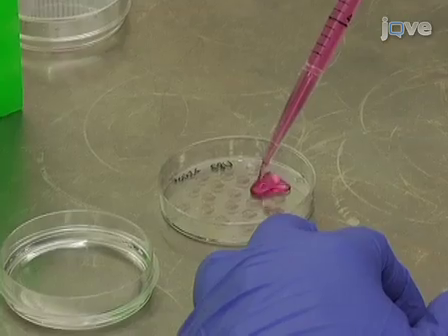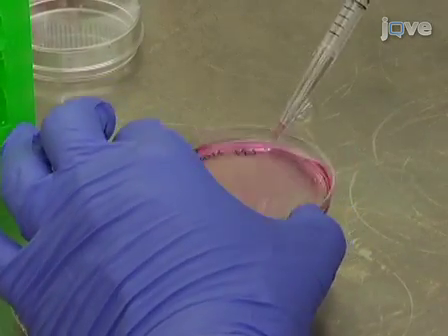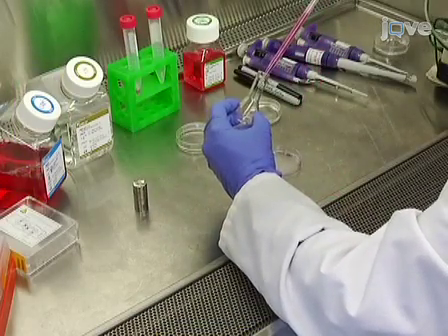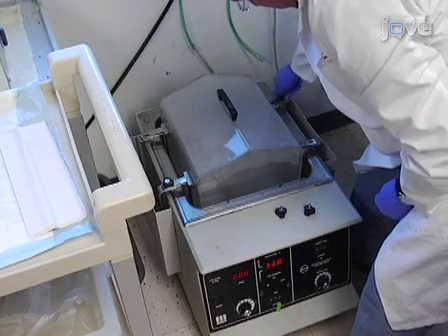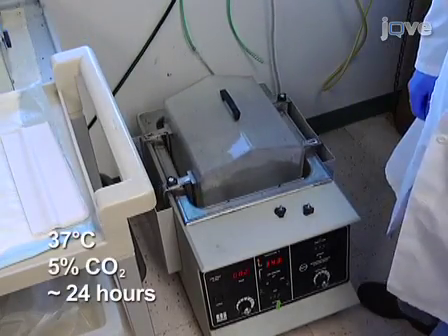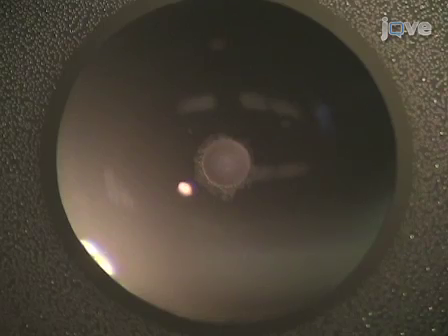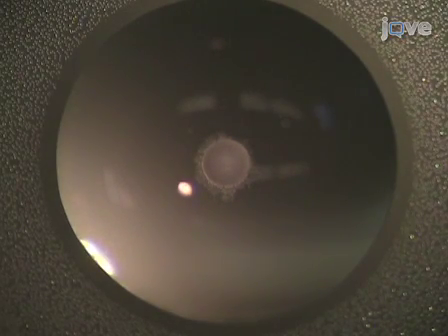Once cell sheets or aggregates have formed, transfer them into round bottom glass shaker flasks containing 3ml of complete medium. Incubate the flasks in a shaking water bath maintained at 37°C and 5% carbon dioxide for around 24 hours until the formation of spheroids can be visualized under a dissecting microscope.